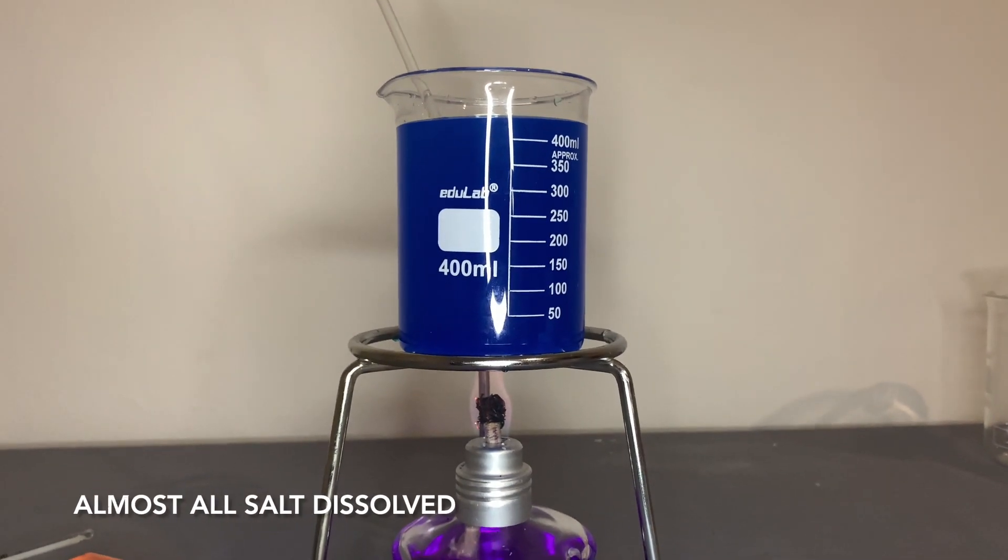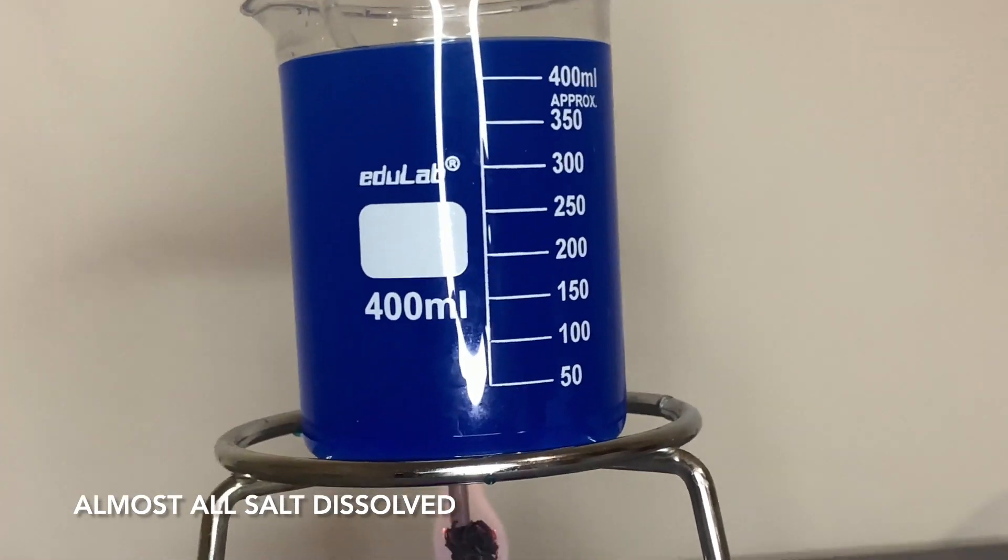After stirring and heating solution, I see that almost all dissolved.